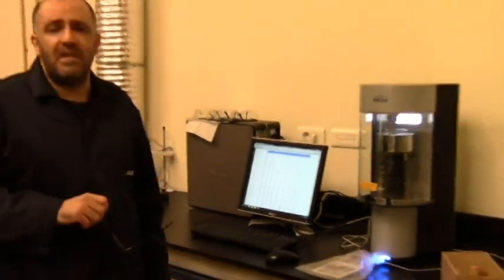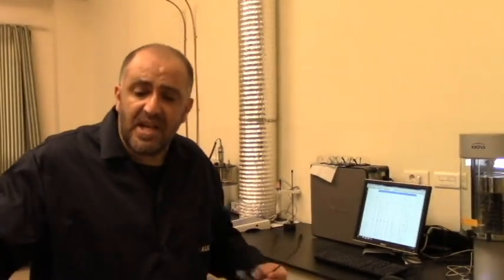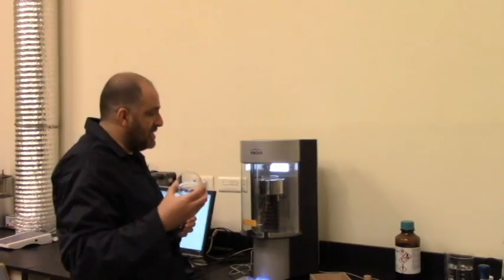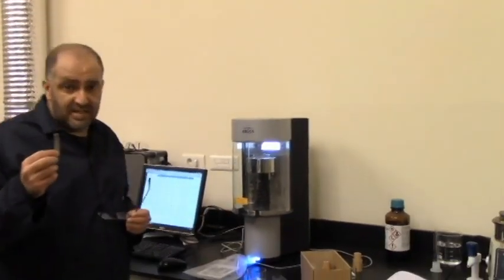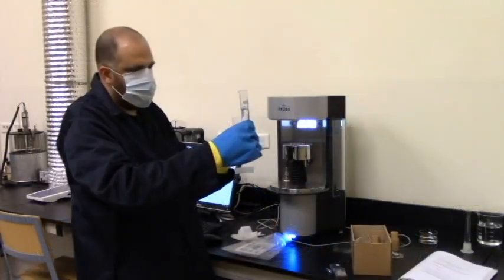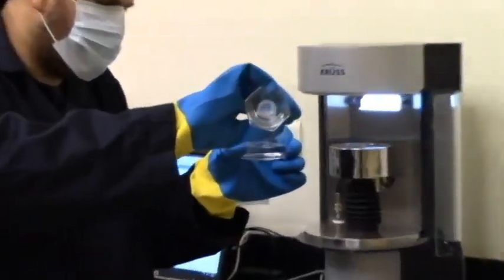Plus, N-heptane is normal. It does not have branches, it's a straight chain, so it is non-polar, which is very important, and it helps in reducing its surface tension. So the other vessel, which has been cleaned, I'll be using with N-heptane and with this plate after cleaning it to measure its wetted length. So let's go. This is N-heptane. Again, about 50 milliliters.